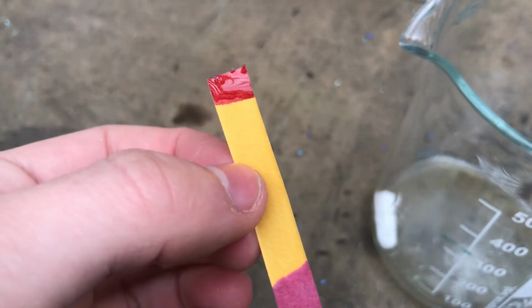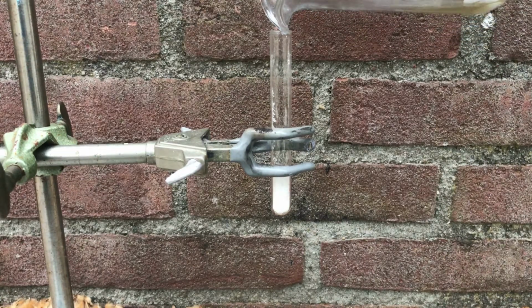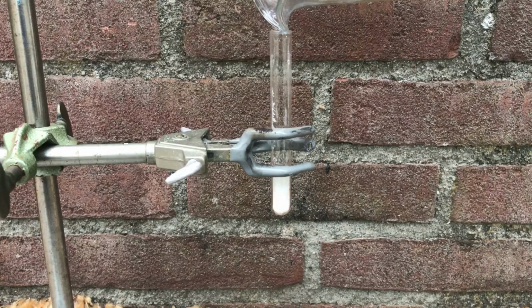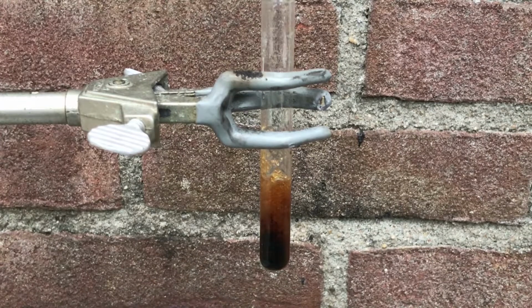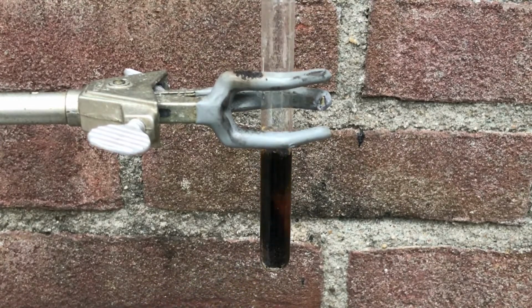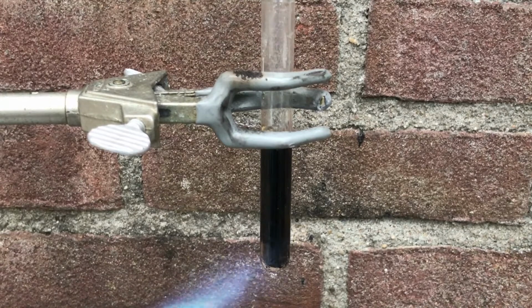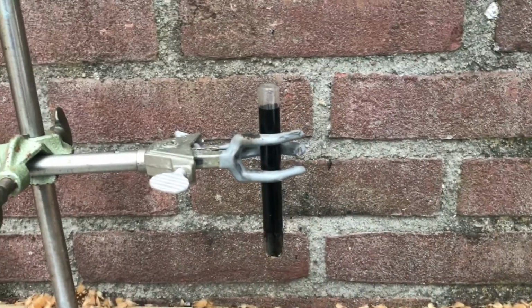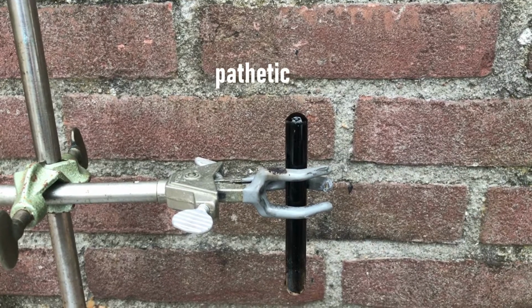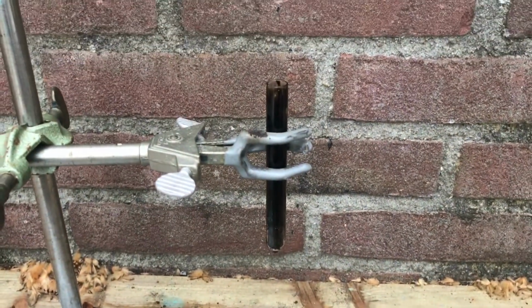Concentrated sulfuric acid has some very powerful dehydrating powers, so let's test if mine does too. I will test this by doing the famous sugar snake reaction. It did not produce a very cool reaction, but it did dehydrate the sugar, so that's a proof that it's sulfuric acid, because oxalic acid can't do that. Black tar.